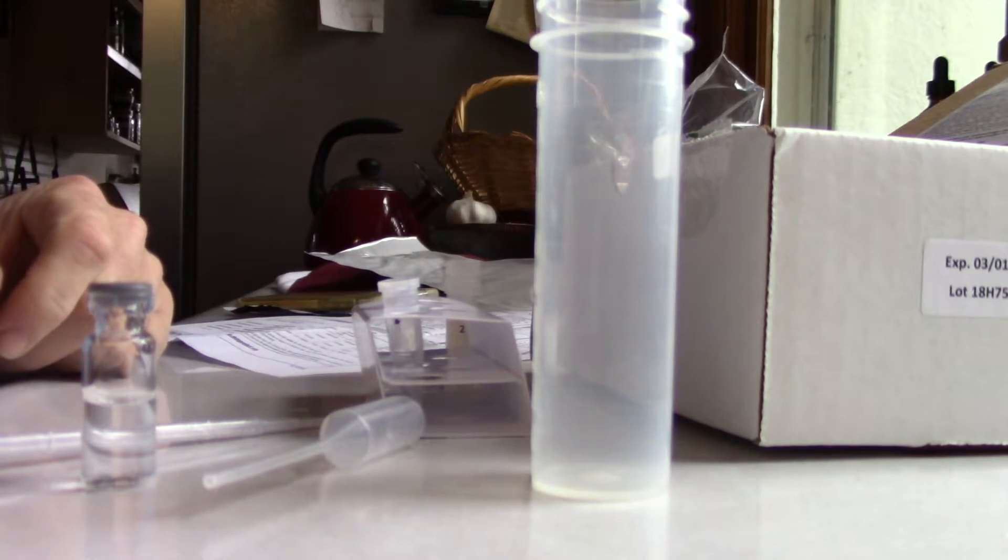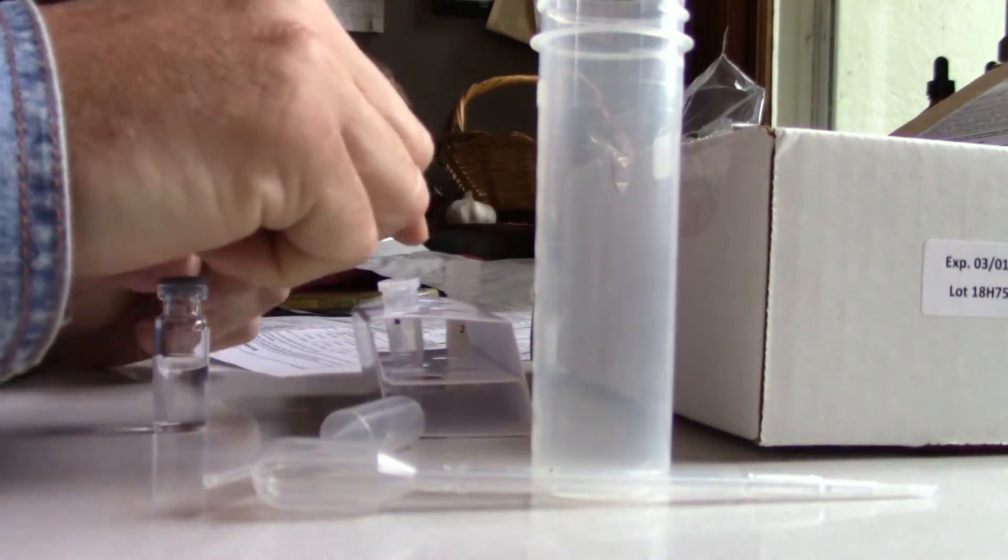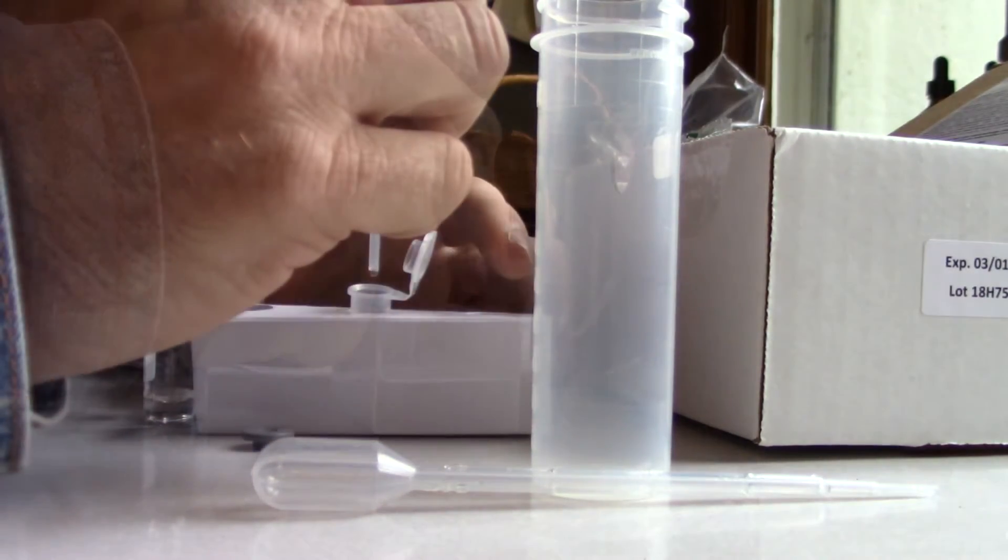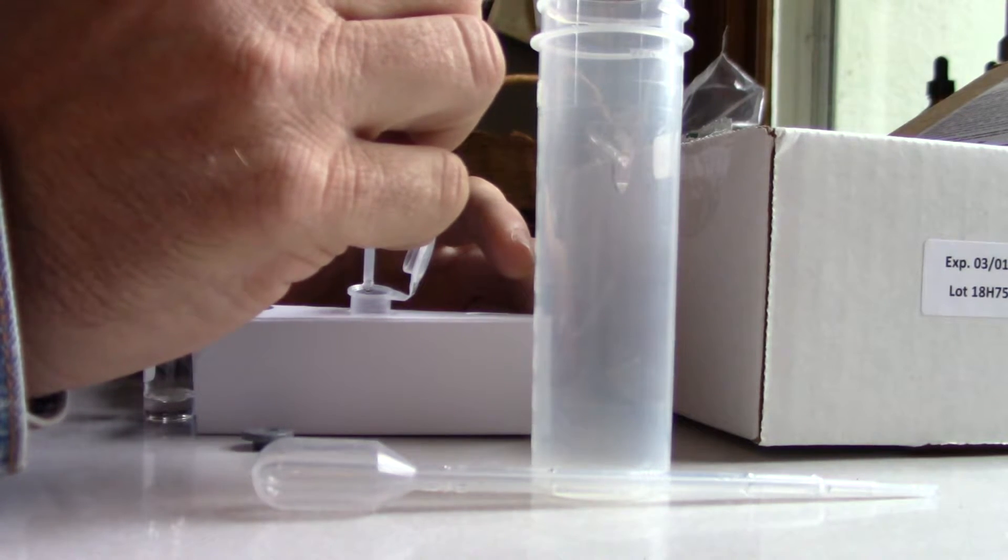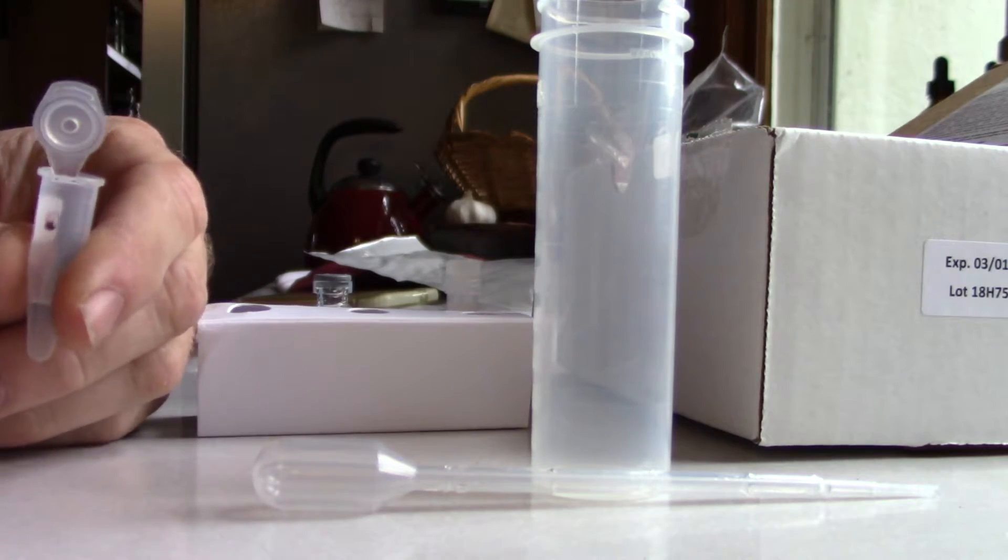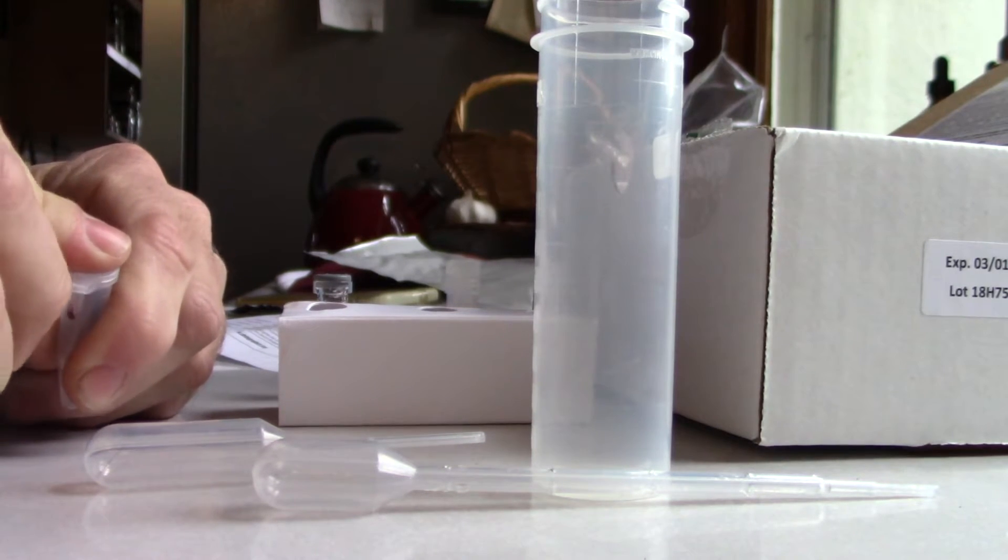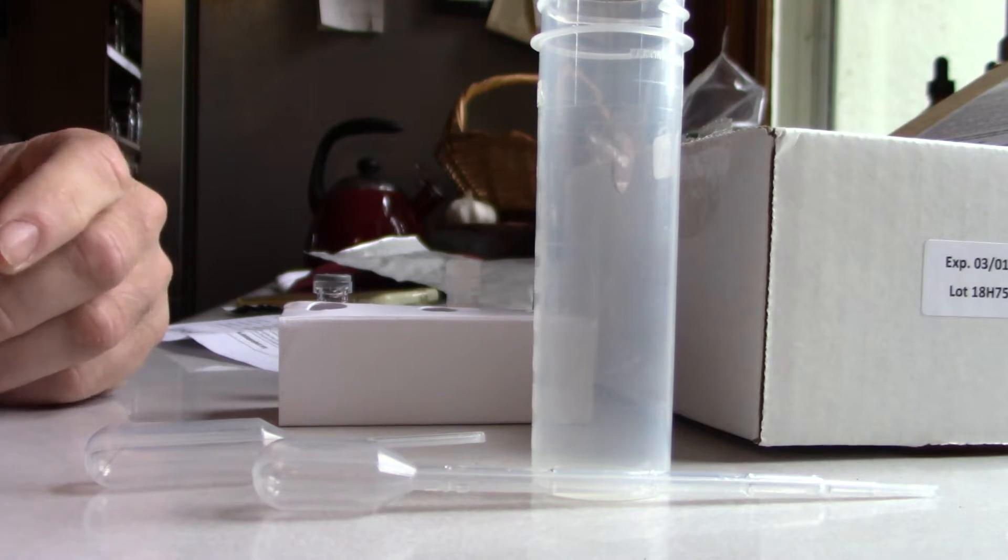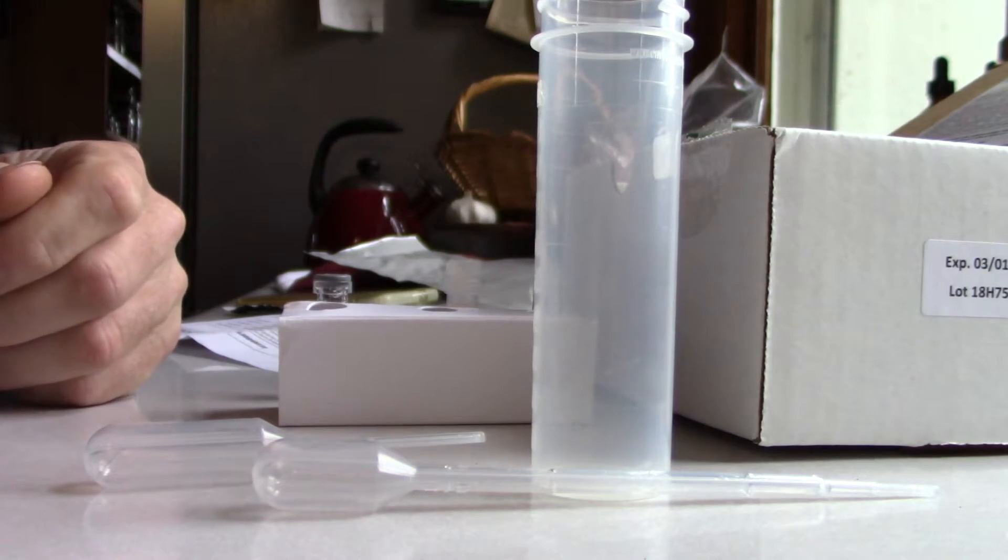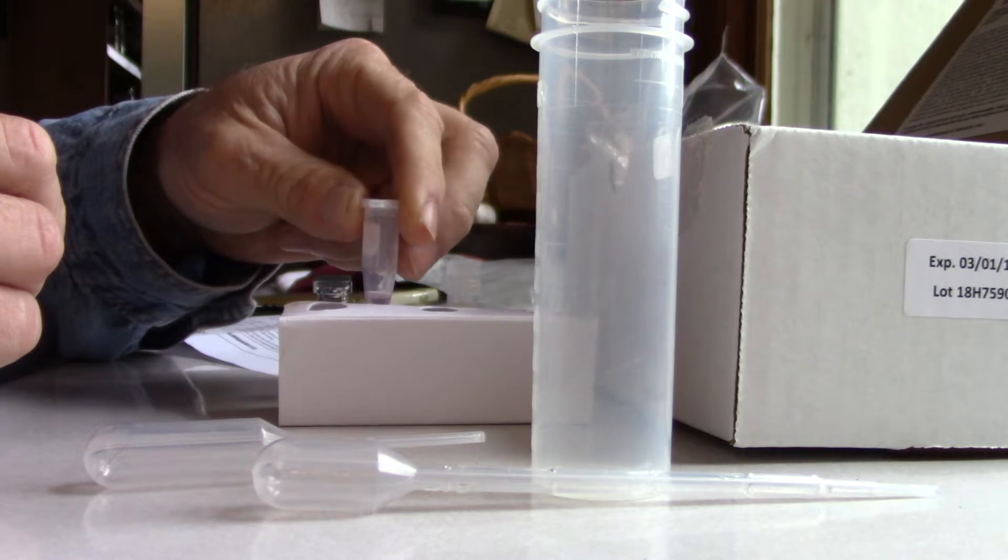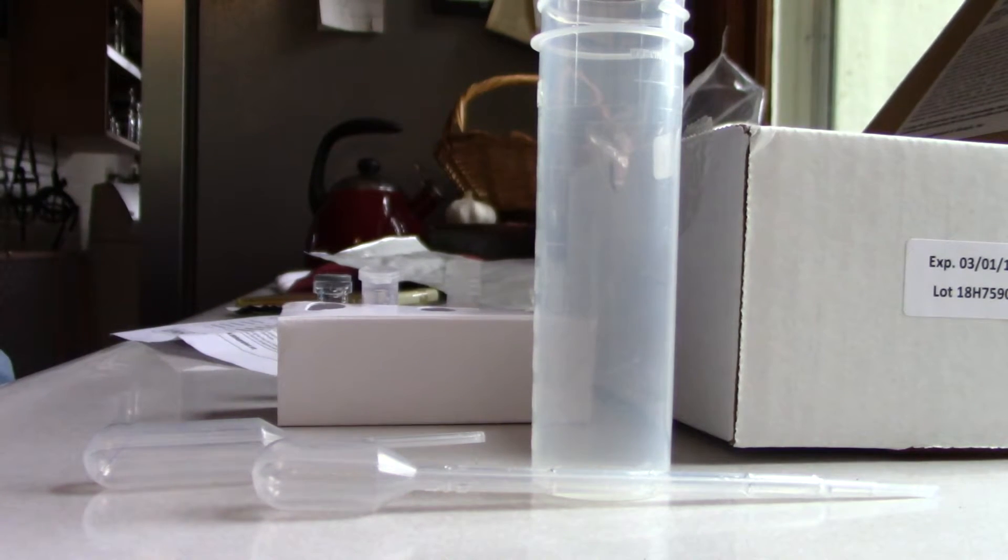All right, this is where I screwed up last time and I put too much of this into this. It's supposed to be six drops. One, two, three, four, five, six. That purple right there is the reagent, so you have to make sure you get it all off. Well, it still doesn't look that much darker. So now we have to wait ten minutes. Alright, so ten minutes. Check in ten minutes.